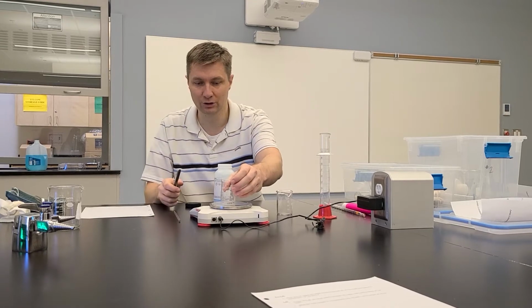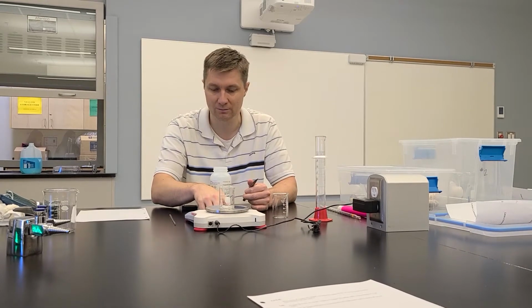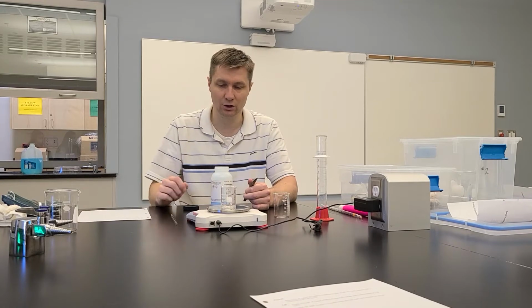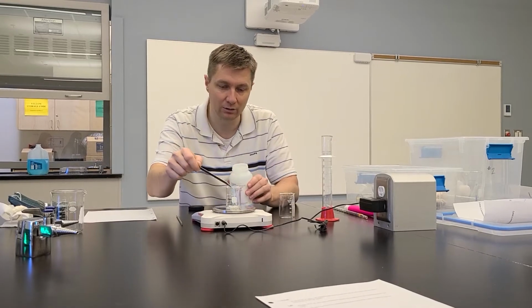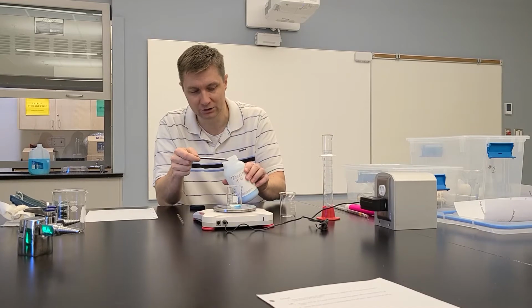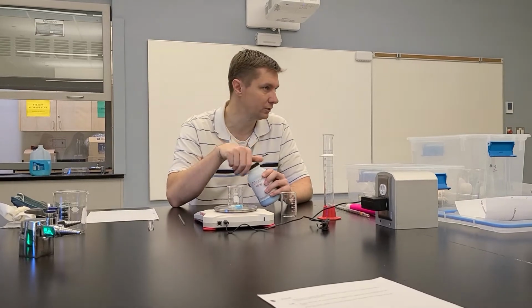So what you're going to do is take this beaker and just stick it on your scale. Use a small one so it doesn't max out the grams on the scale. Hit the 0 button, so now it's at 0, and you just add in whatever the calculated amount is. Okay, when you calculate that amount, make sure that you check that calculated number with me so that you can be told, yeah, that's the right number, and you can start the dilution.